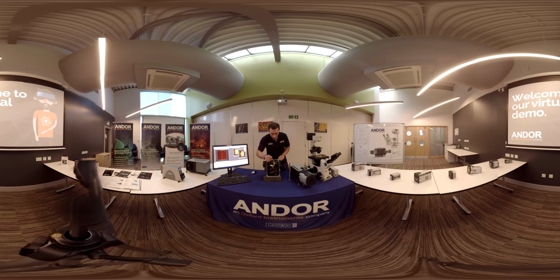From the focus mirror, you have the optional side exit port mirror, which will take you to an exit slit and a single point detector perhaps, or perhaps an InGaAs camera to extend your wavelength range.